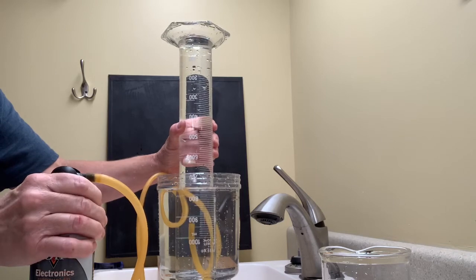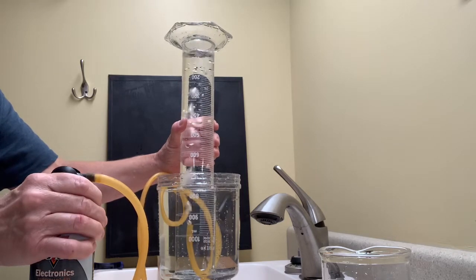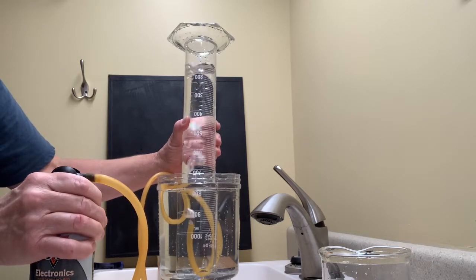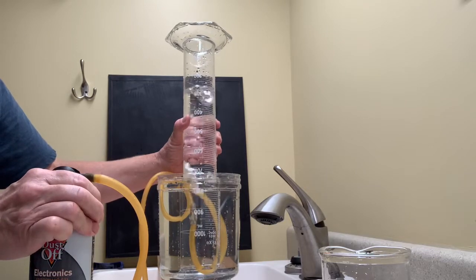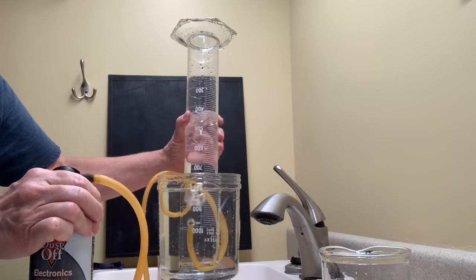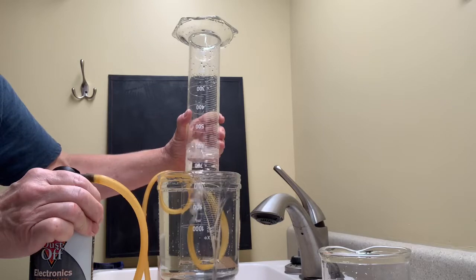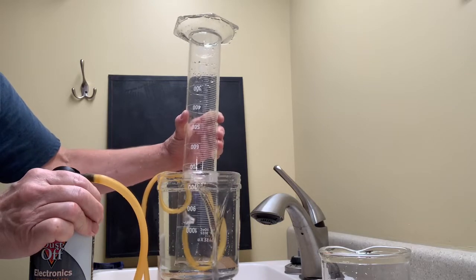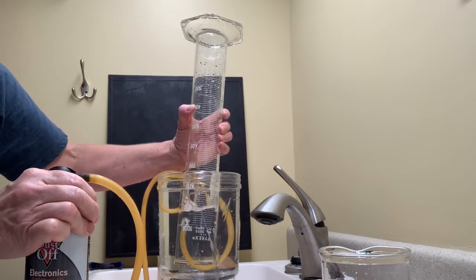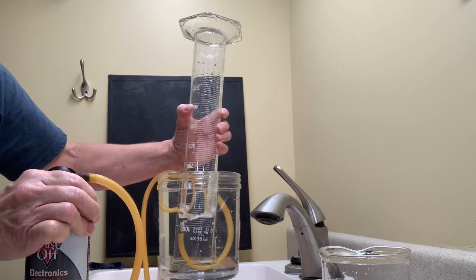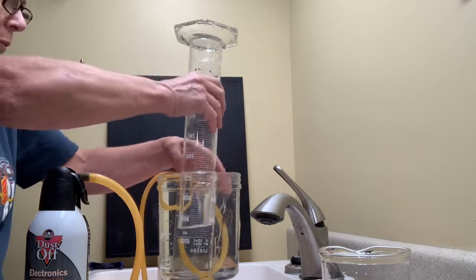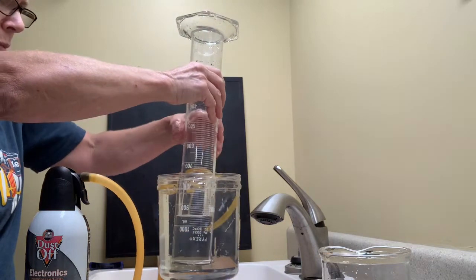I'll put this in double time. It does take a little bit longer because we are adding quite a bit more gas this time. And I want to be sure and not put too much gas beyond the markings. You can see the water overflowing into the sink. And now I'll remove the hose from the cylinder.